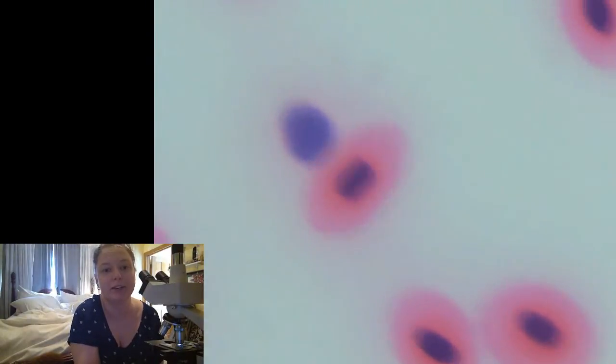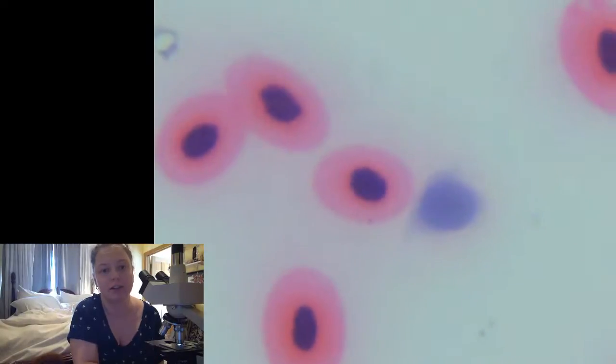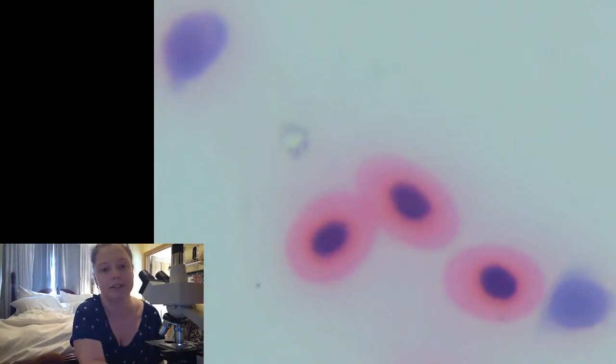Like when you look at bacteria on slides, which we will probably do in a couple weeks if I keep doing live streams, bacteria aren't actually those colors. We just use different stains. Those are probably nuclei, which is interesting because human red blood cells don't have nuclei. So that's really an interesting thing to see there.